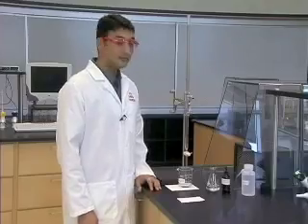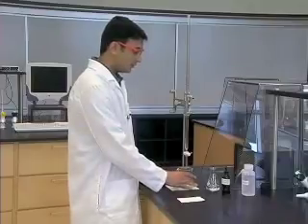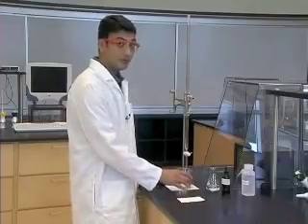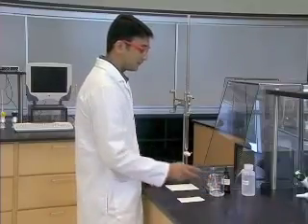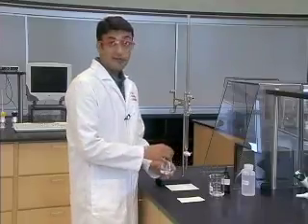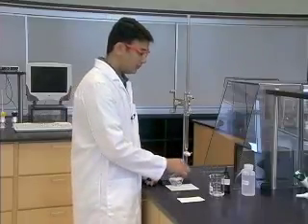Now the analyte can be added to our experimental setup. The waste beaker is removed from below the tip of the burette and placed on the side. Our analyte is in this Erlenmeyer flask which I am placing below the tip of the burette.